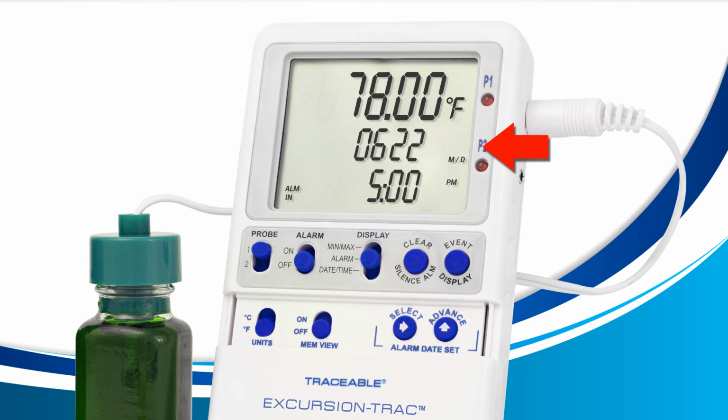The middle row says what the date was when the current temperature returned in range of the high and low alarm. In this case, it's June 22nd. And lastly, the bottom row says what time the temperature returned in range of the high and low alarms. In this case, it returned in range at 5 p.m.